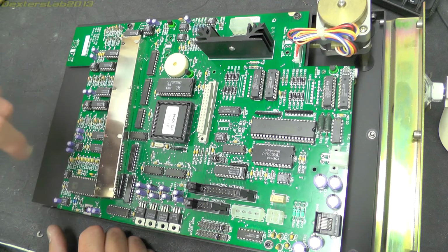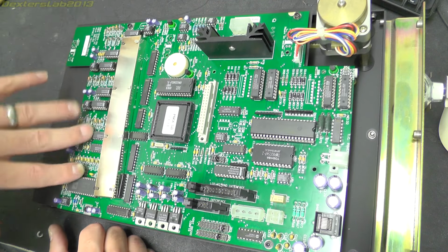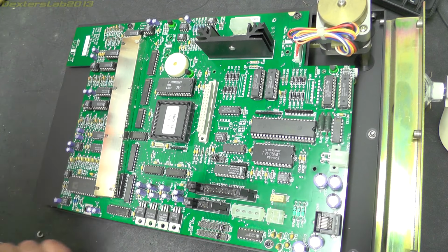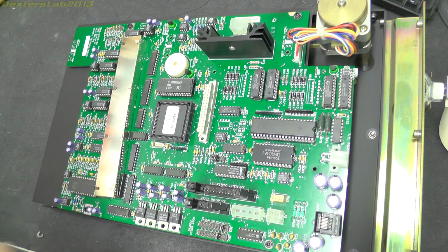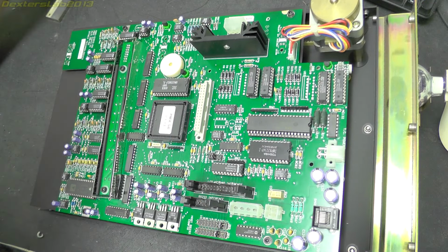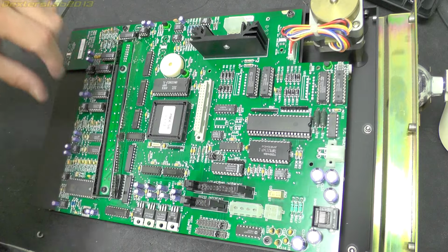Then we have a few more 74 series ICs, a shielded can, and a load of analog looking circuitry, and just there it looks like we have an ADC. Again, I'll look at the detail of that in just a moment. Now, given that we have this shielded area just here, that's going to be way too small for any kind of photo multiplier device, so my guess is that these are photodiodes in here, and that's why they're shielded. So I'm just going to prise open these tabs, and hopefully we can release that can and actually have a quick look underneath. And that didn't really reveal much, but yeah, this is looking more likely there's some diodes in there.